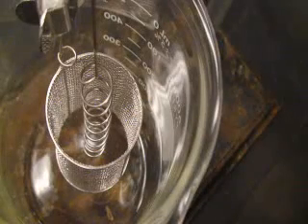Using one of the clamps attach the platinum cathode onto the stand and place it in the center of the beaker with the solution. Attach the platinum anode onto the stand using the other clamp and lower it into the beaker containing the cathode and solution, ensuring that they do not touch and the anode is in the center of the cathode.